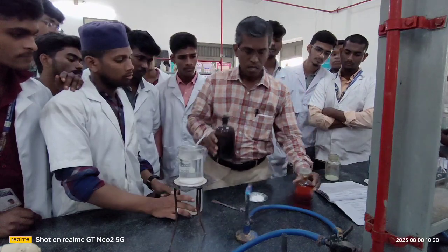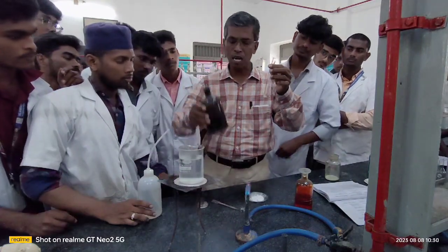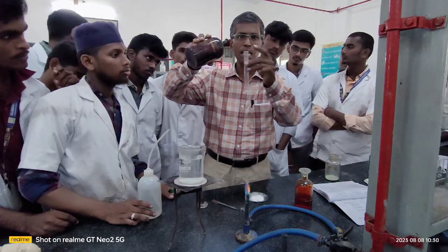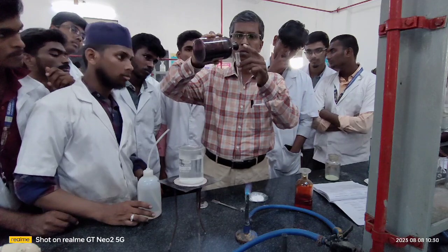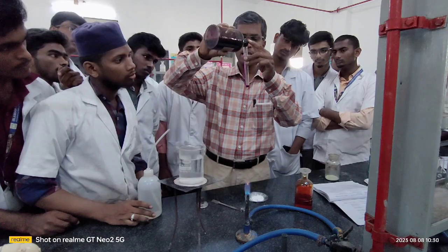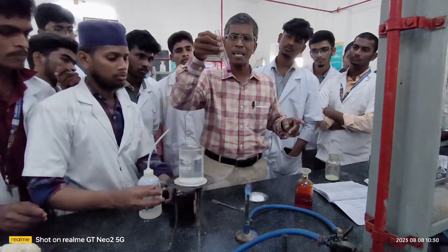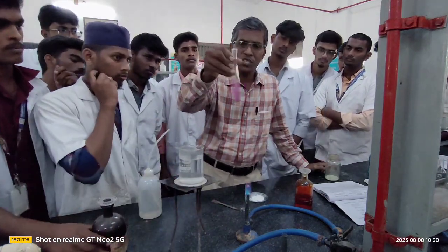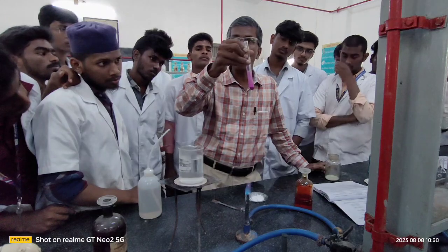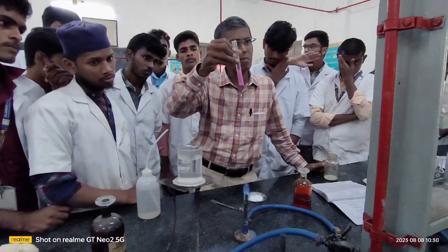Now, I have taken a small amount of organic compound, just in milligrams. To this I am going to add a little of your potassium permanganate solution, not too much. See here, the color of potassium permanganate is dark, something like purple. Try to shake well and see the result, whether the color of potassium permanganate remains or disappears. This is the observation you have to follow. This is the step you have to follow.